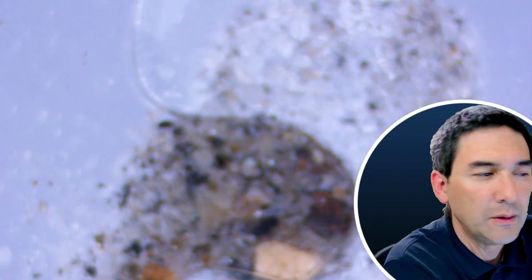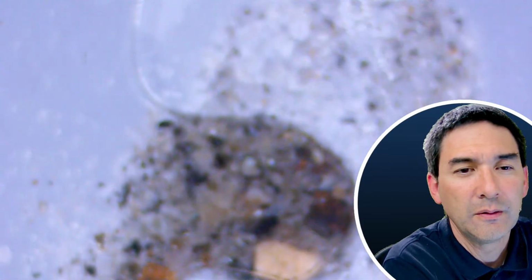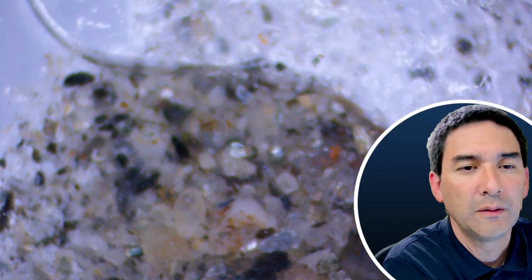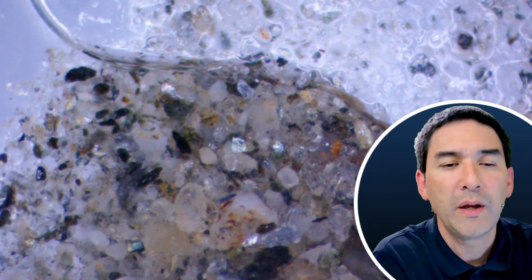So, need to focus a little bit. Yeah, you get the idea. I think it's still way too dense.